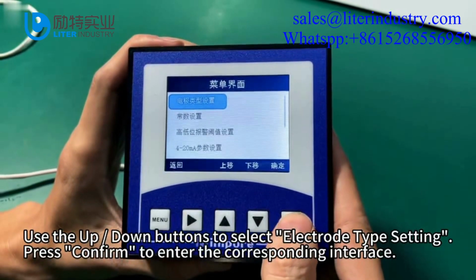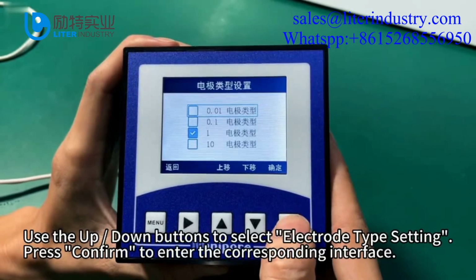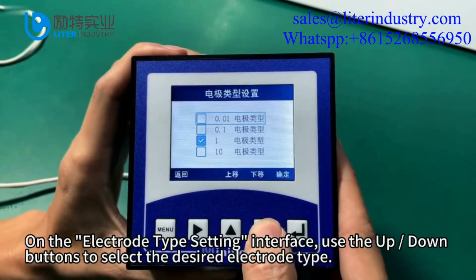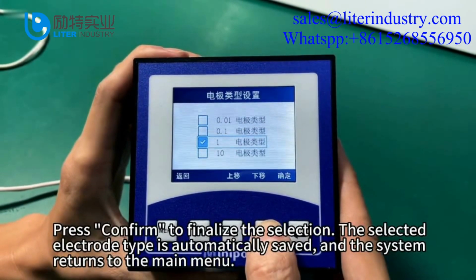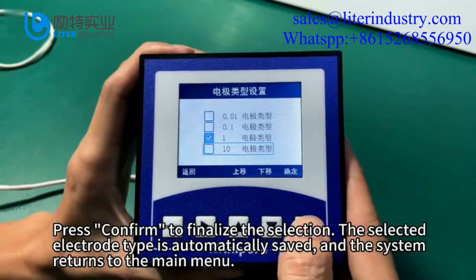Use the up-down buttons to select electrode type setting. Press confirm to enter the corresponding interface. On the electrode type setting interface, use the up-down buttons to select the desired electrode type. Press confirm to finalize the selection. The selected electrode type is automatically saved and the system returns to the main menu.